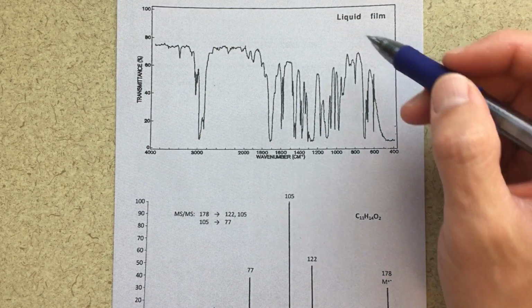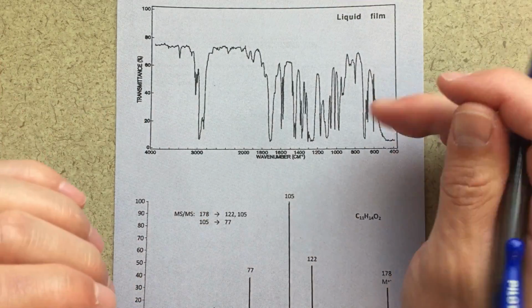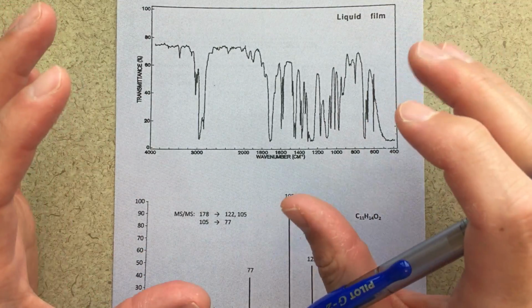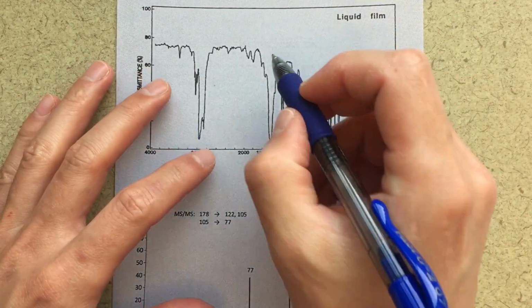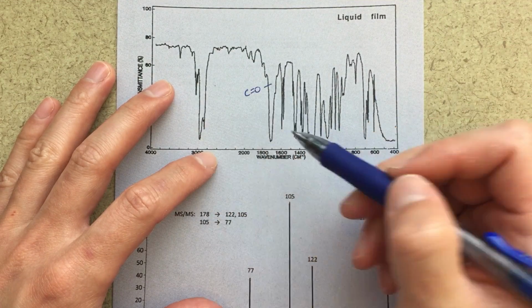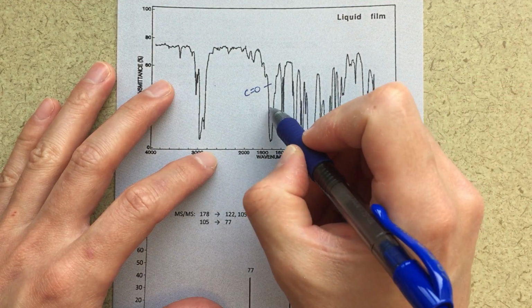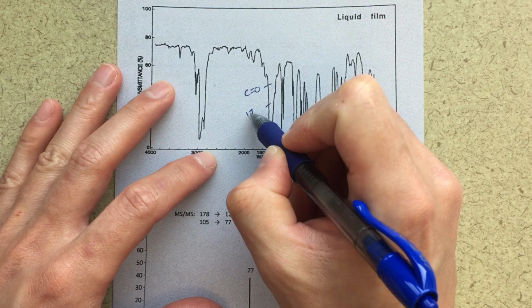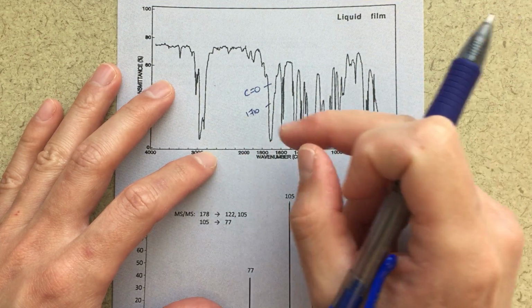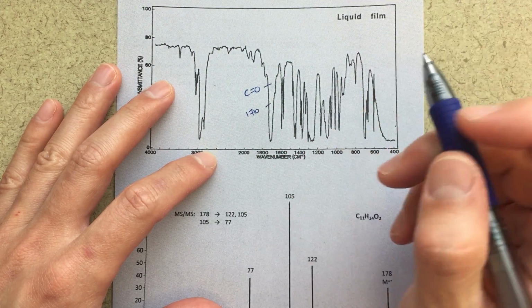Anyhow, the IR, I do know what it says, and I can talk about that. So the first thing that really jumps out at me when we're looking at IR for the first time, we want to look at the really obvious things first. We want to say, this is really obvious. I know for sure this information, and I know for sure that this is a C=O. I know this is a carbonyl carbon-oxygen stretch. I'm going to estimate the wave number here at 1710. And that's really obvious to me. It just really jumps out. I think that for sure that's indicative of a C=O. So I think that we can label that.